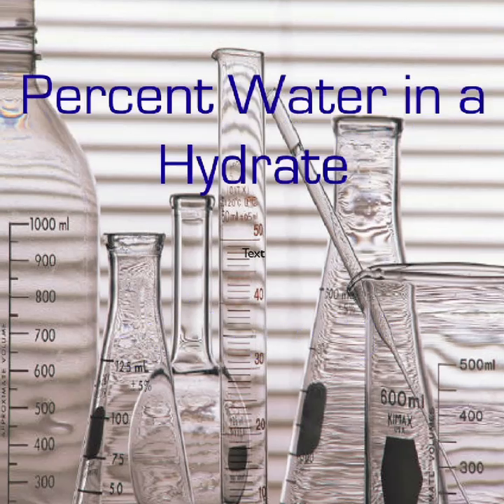In today's lab, we will be determining the percent water in a hydrated compound. The polarity of a water molecule, which makes it a great solvent for ionic compounds, causes water molecules to cling to the structure of solid substances. When this occurs, the trapped water molecules are called water of hydration, and they become an integral part of the crystal structure. There are many compounds that have a tendency to absorb water vapor from the air. These are said to be hygroscopic.